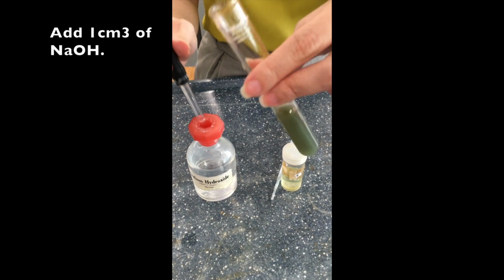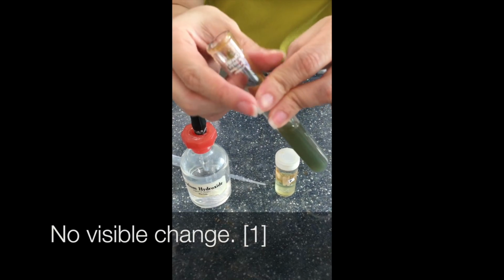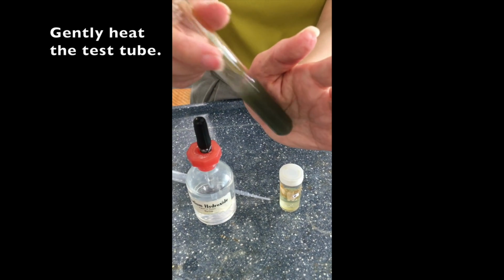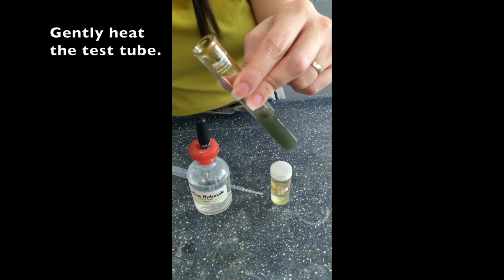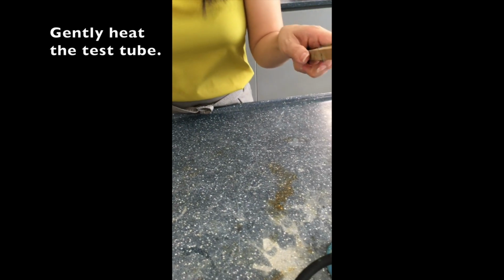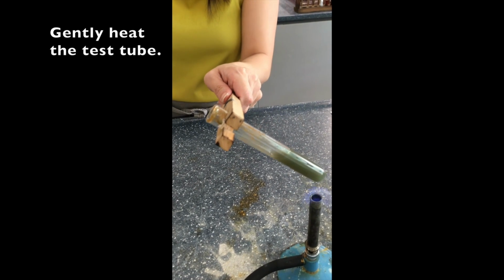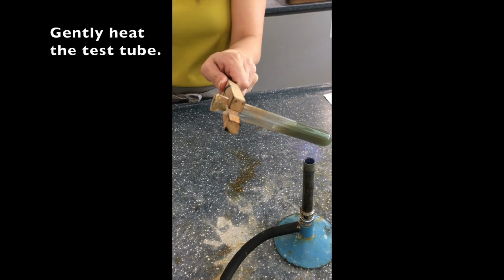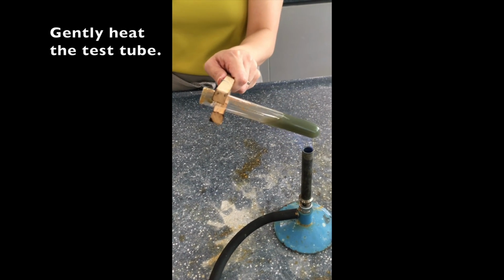Okay, so next they add a further 1 cubic centimeter of sodium hydroxide because now we are proceeding to test for ammonium ion. So now we would like to gently heat the test tube. So here we are expecting to see ammonia gas if ammonium ion is present.